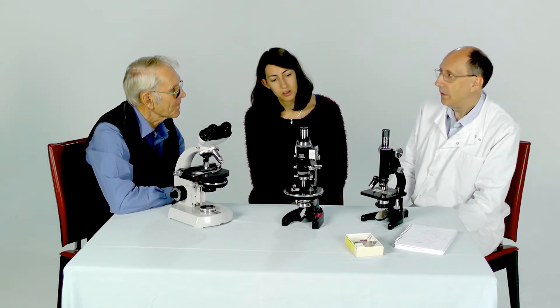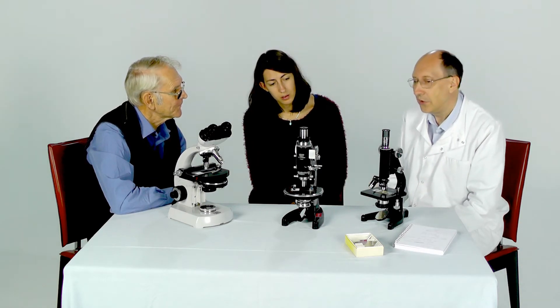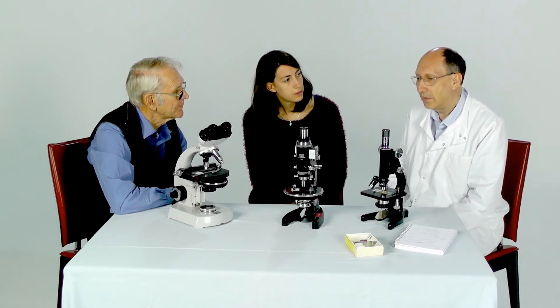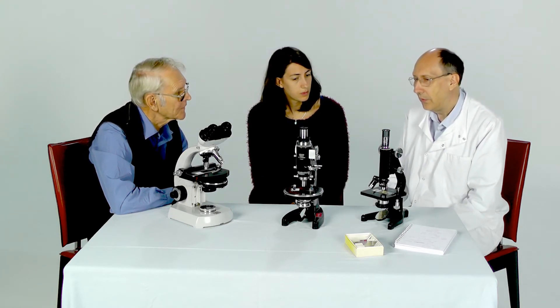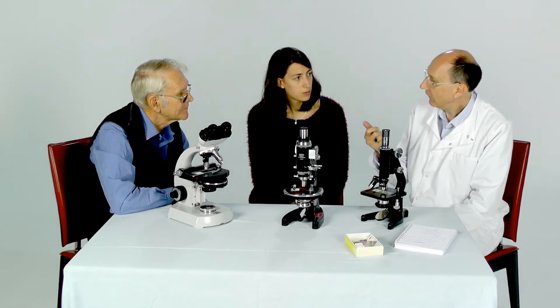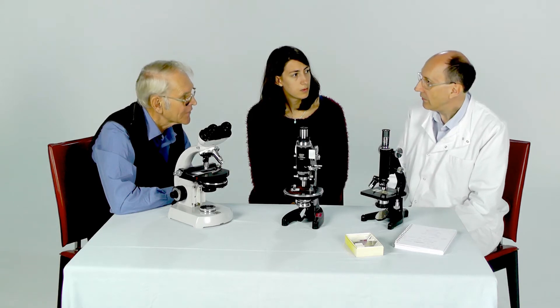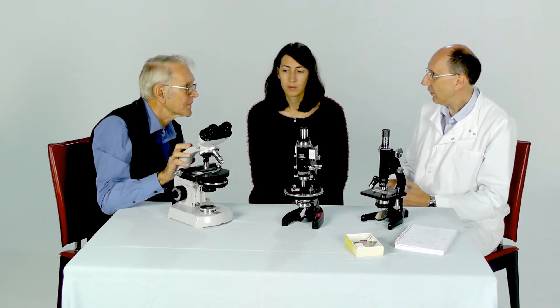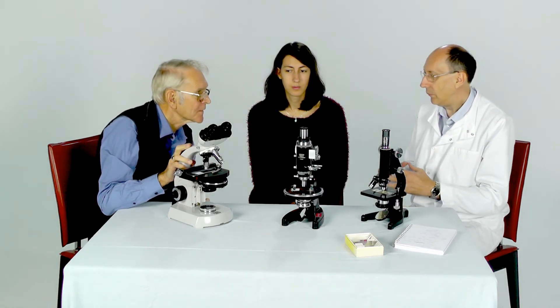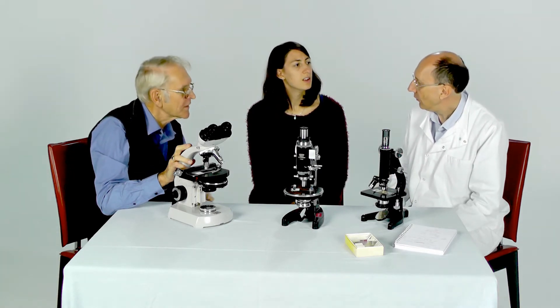We're getting into quite a lot of complicated detail now in terms of the optics of the condensers and the microscopes. But there is a key iris aperture that has to be adjusted within the condensers, and that actually optimises both how much glare you get and the cone of light that is possible.